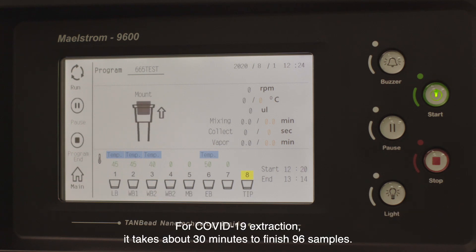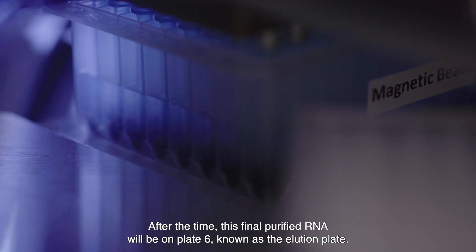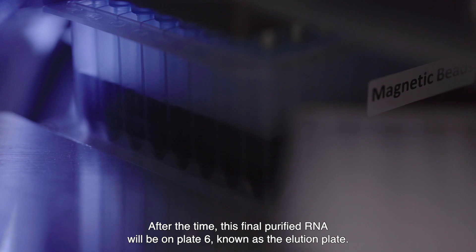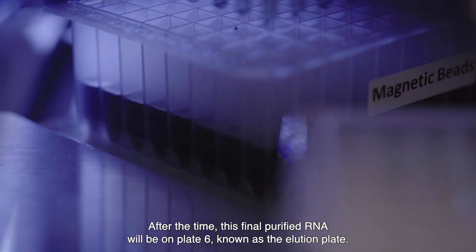For COVID-19 extraction, it takes about 30 minutes to finish 96 samples. After the time, this final purified RNA will be on plate 6, known as the elution plate.